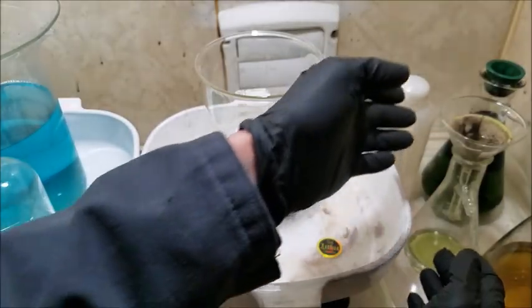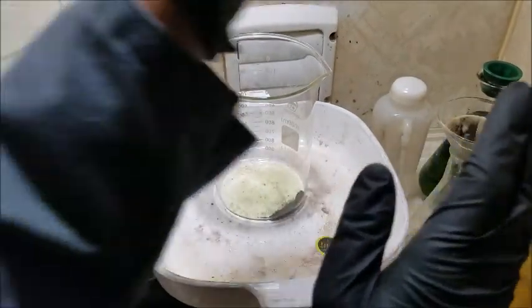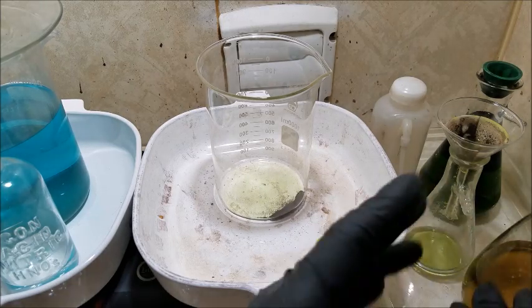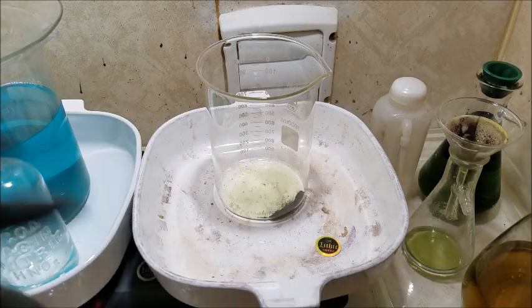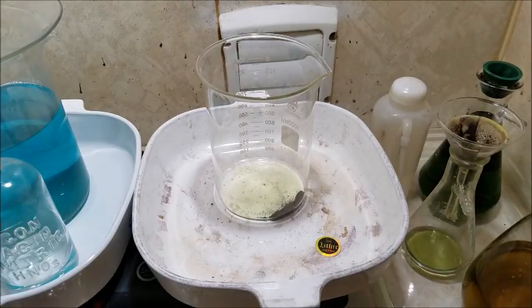You notice the dark color of our solution. So we definitely separated this material from that. That is so dark green. I can't imagine that there was that much copper in solution that would do that. Iron. I know platinum group metals can get that yellowy green. That's so dark though.